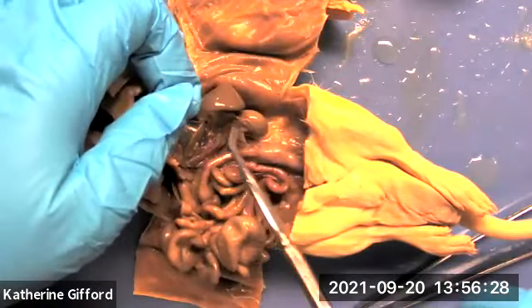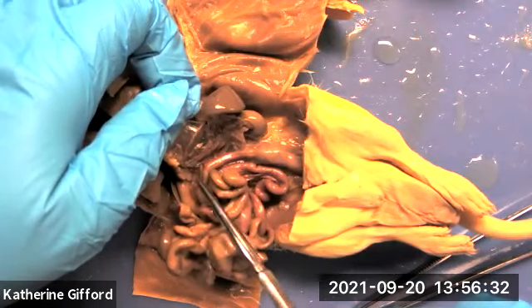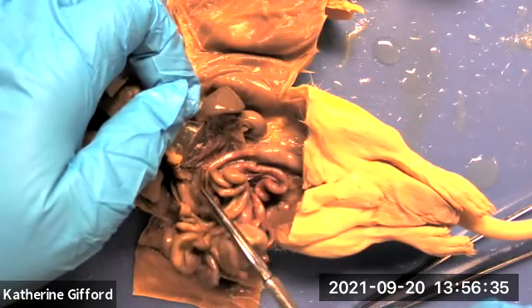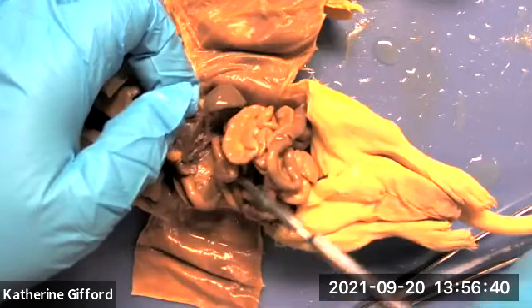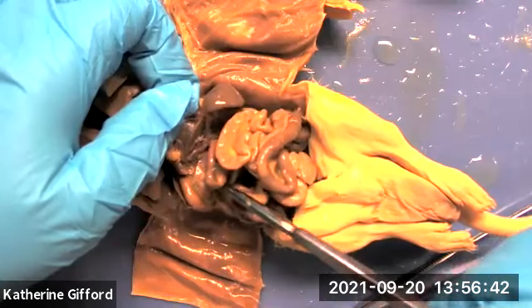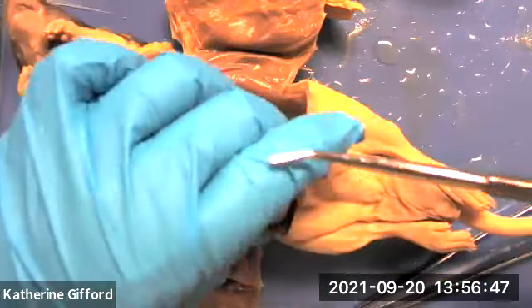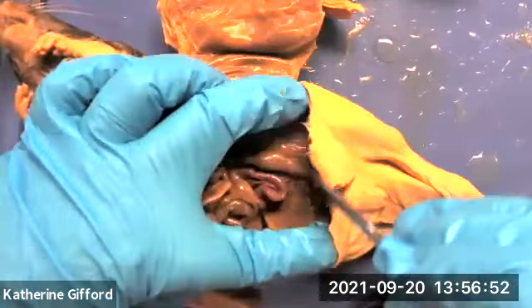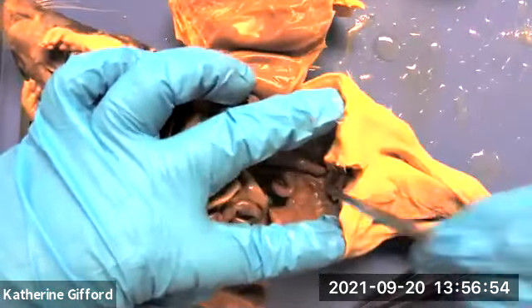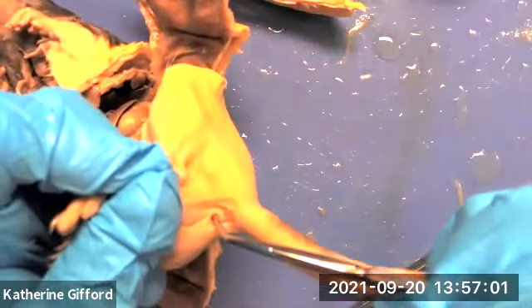The pancreas is embedded in this mesentery — it's all of this glandular tissue and it extends all the way across to the other side of the body. The contents would eventually go into the rectum, and the anus is the opening at the base of the tail.